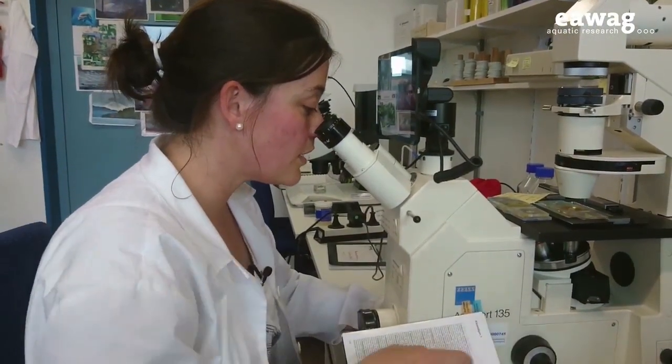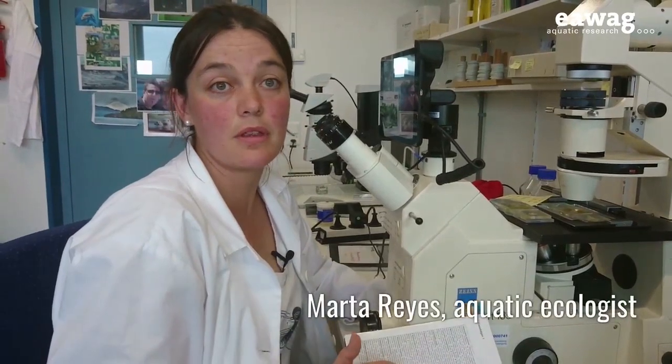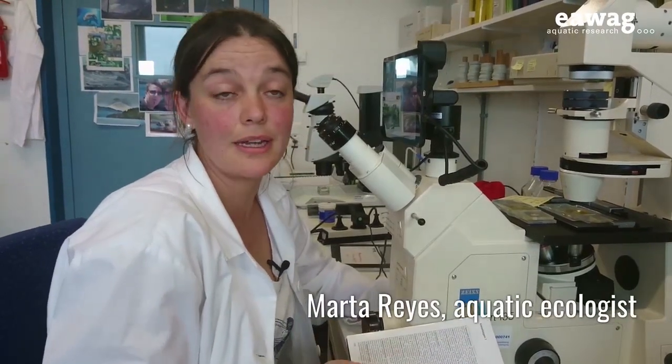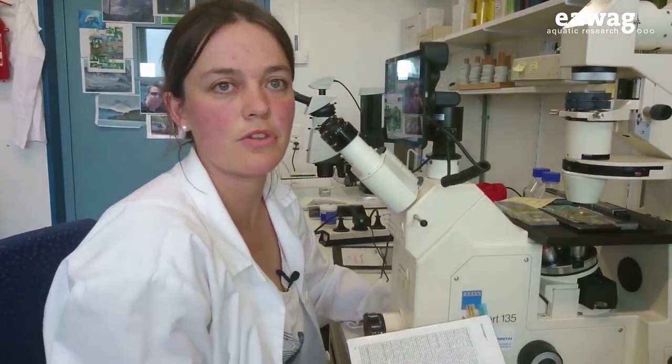Now I'm counting and identifying the different organisms that are on the lake, and that's a time-consuming job.